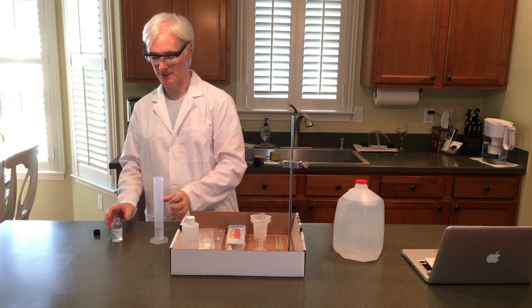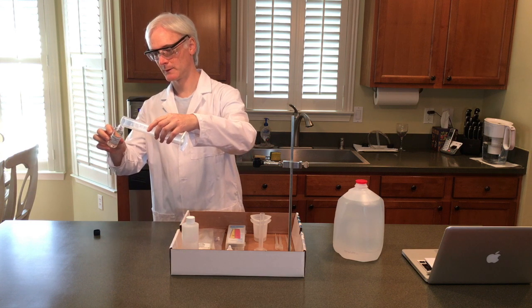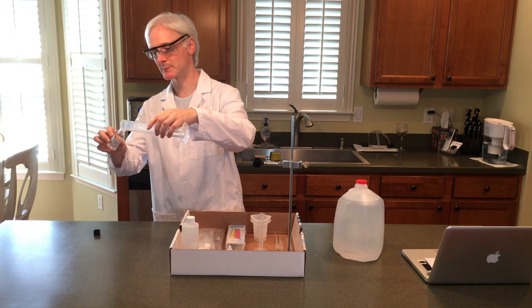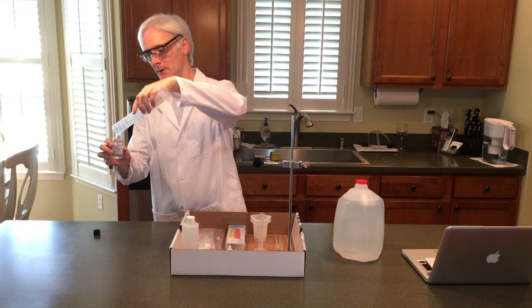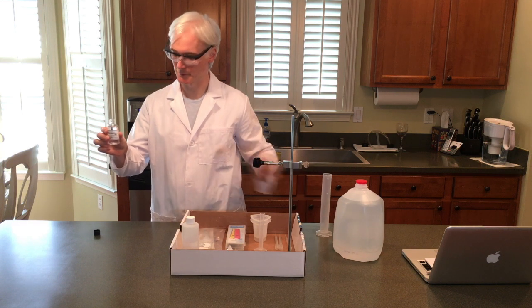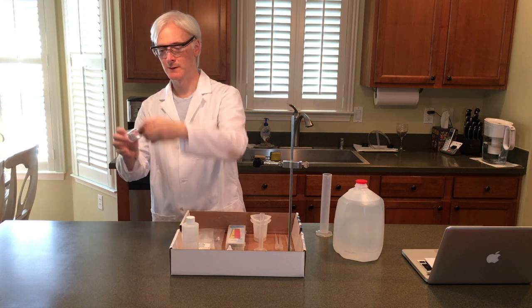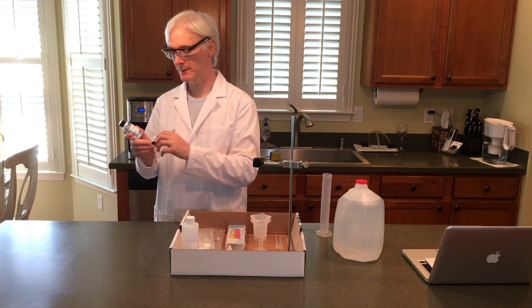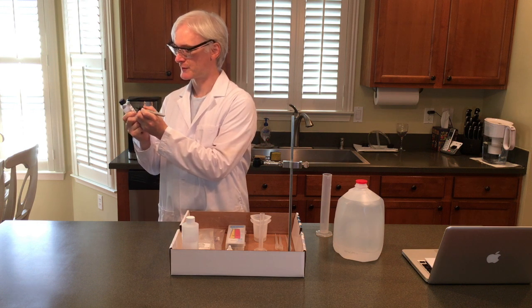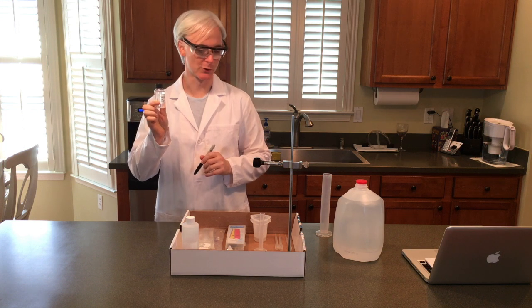Open the cap, and very gently we're going to pour the water into the sodium hydroxide. Tilt it away from your face. Make sure you don't get any backsplash. Nice and gently down the side. There we go. So this dilute sodium hydroxide is going to be good for all of the remainder of the experiments. The label says 0.2 mole, but we need to change that to 0.1. So just take your sharpie, cross off the 0.2, write 0.1 mole, and we're good to go.